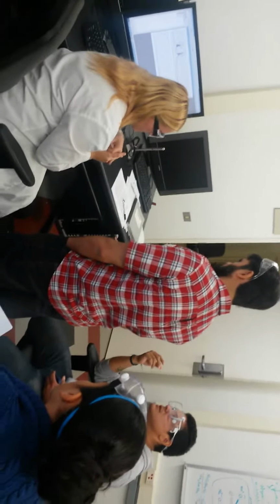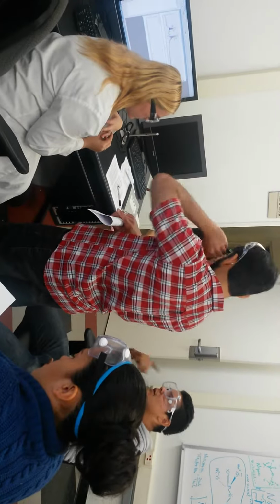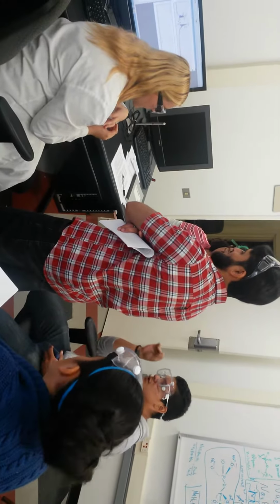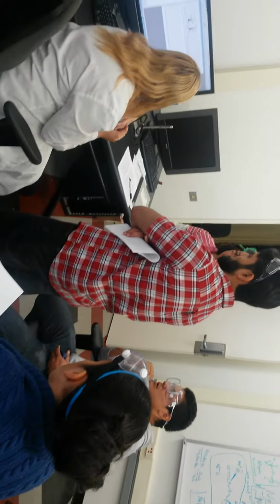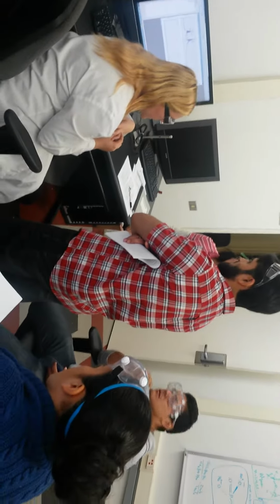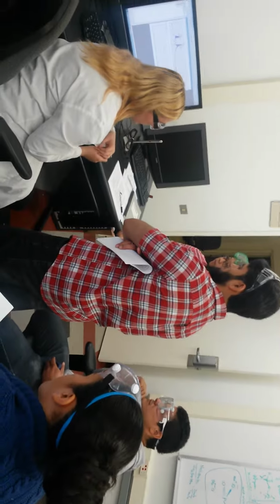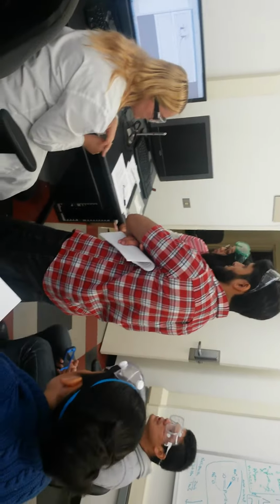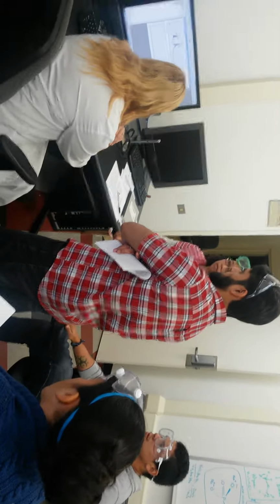Right. Exactly. That whole time that it's going through that is not taken into consideration. Once it enters the mass spec, it should have the same time. Well, it's only off by like 0.1. So it's not that long of a difference. It's not like it's a minute off. It's only off by like 10 seconds. But it's contact closure, that's the reason why. Because they're not the same instrument. They're not the same company. Two different separate pieces of equipment.